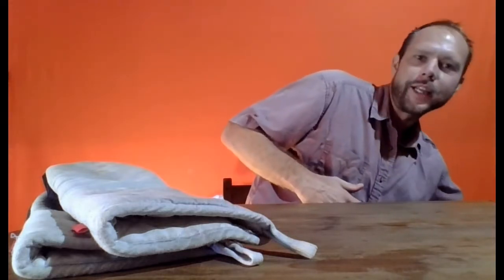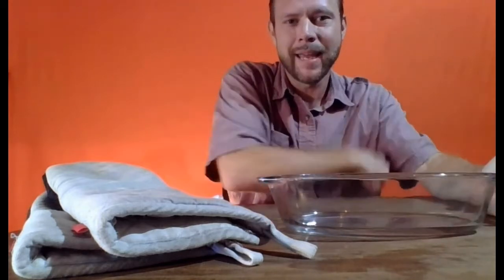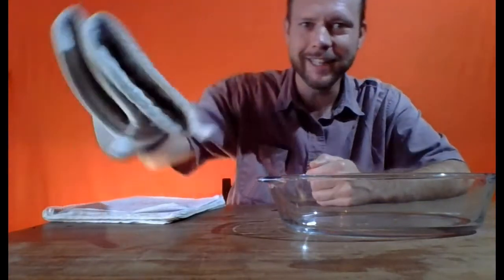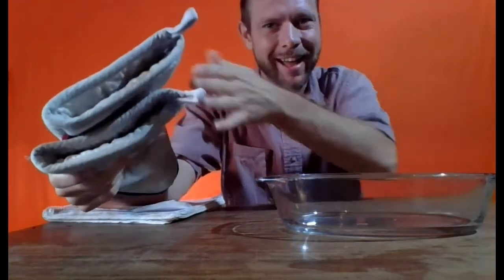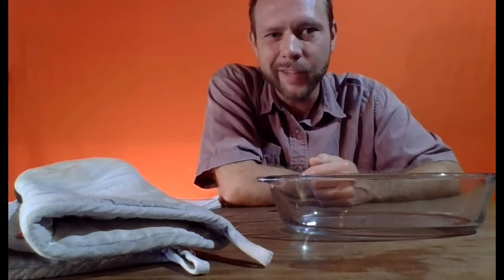Rather, what we're going to do is work in maybe like a glass baking dish in the oven. We'll have a lot lower temperature in the oven, and even though the temperature is, quote, relatively lower, it's still going to be hot, right? The main thing is you want to make sure that you have some oven mitts while you handle things. Now, we're going to work with the oven on approximately medium heat.